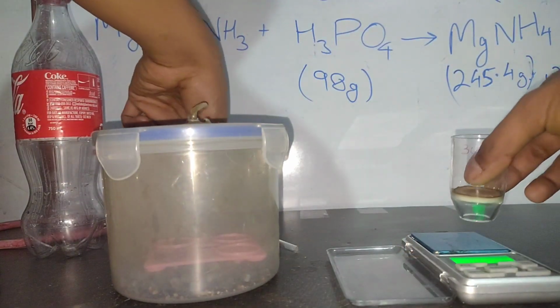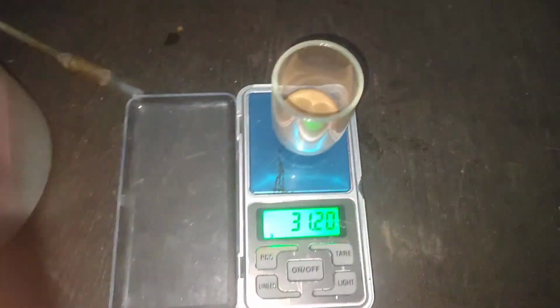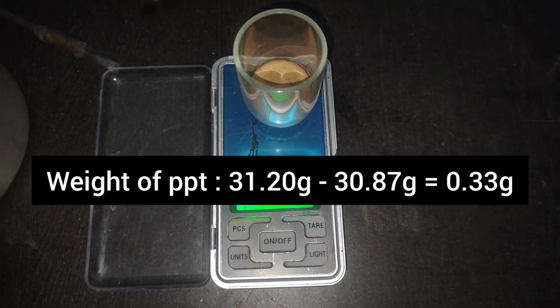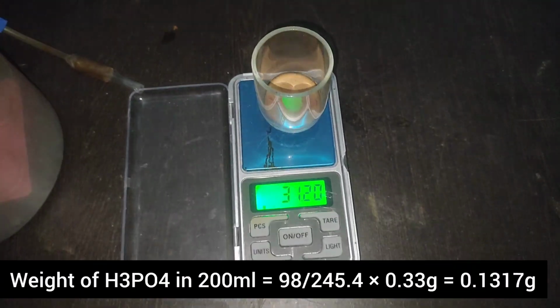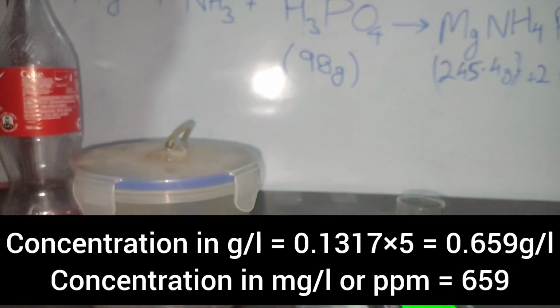when its weight became constant, which became constant at 31.2 grams, I did all my calculations. You can see on the screen right now. So the phosphoric acid content came out to be 659 ppm or milligram per liter.